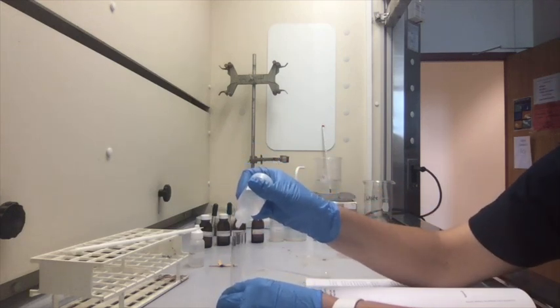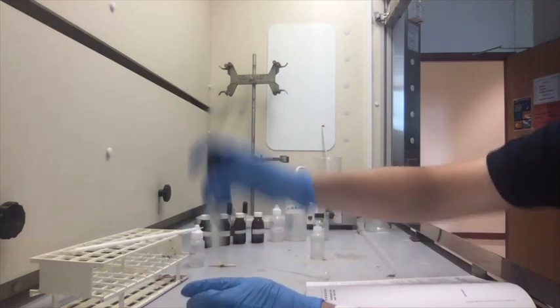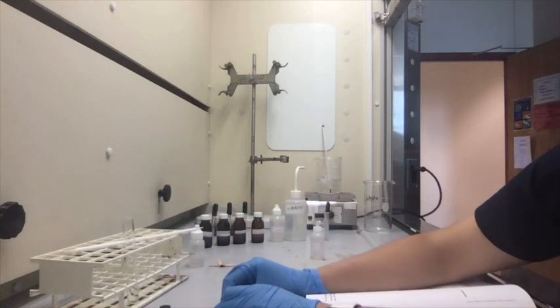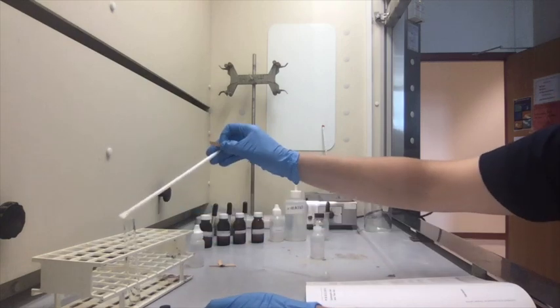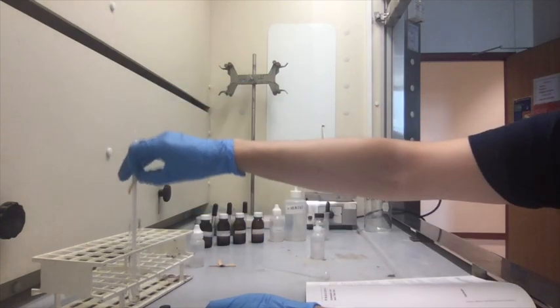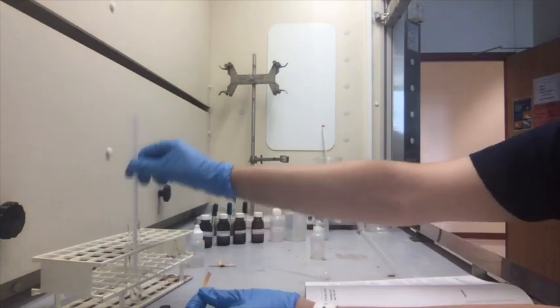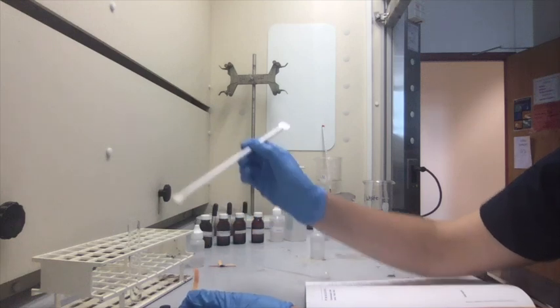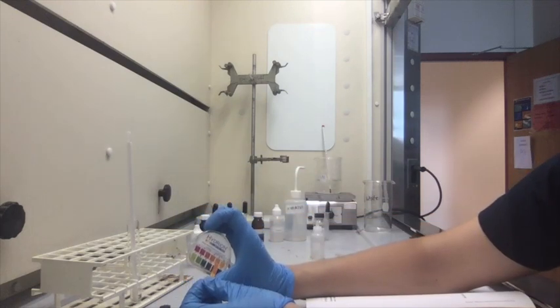I'm going to add another 5 drops. So 1, 2, 3, 4, 5-ish. Give that a mix. So now it's about a 5.